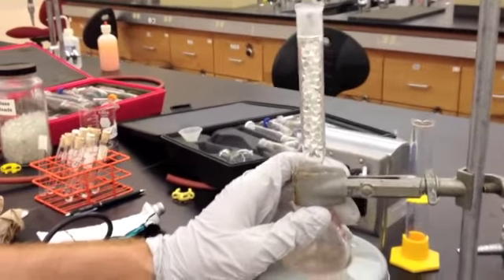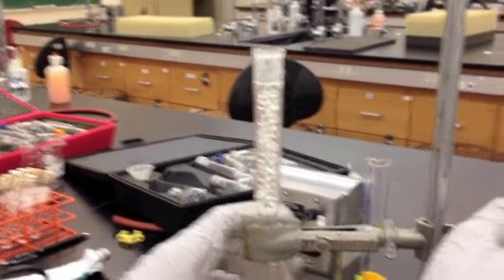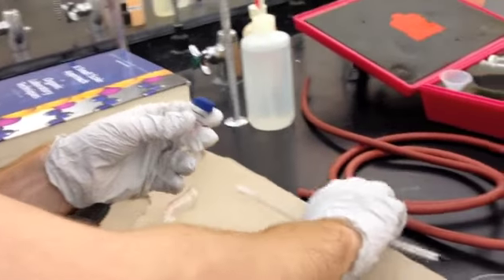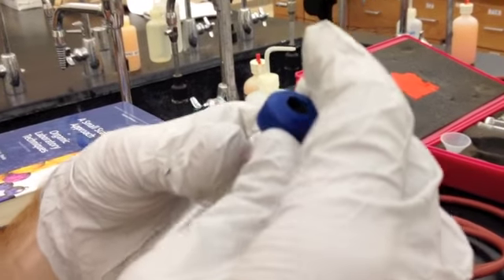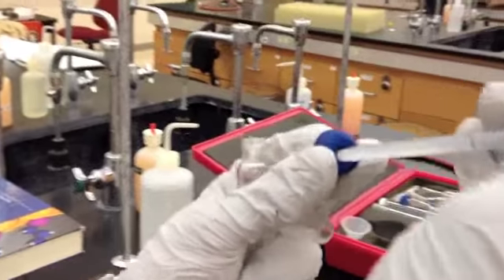Adjust your lab jack as needed. Next, we're going to add our distillation adapter. But before we do that, we want to fit the thermometer onto it. When you open up the distillation adapter head, you have a little O-ring. Make sure not to drop it. You put it on the inside so you can stop the thermometer.